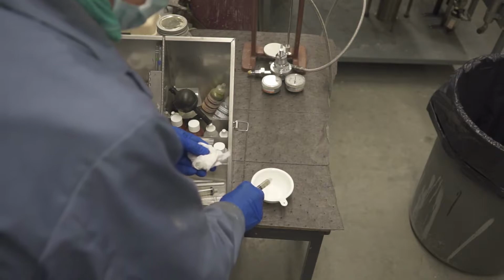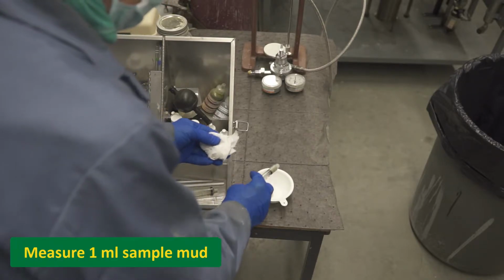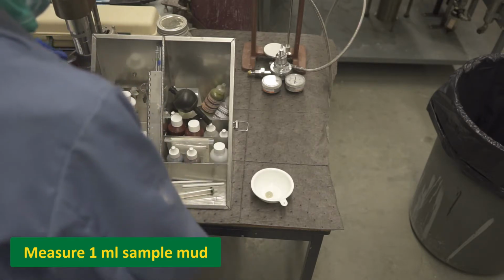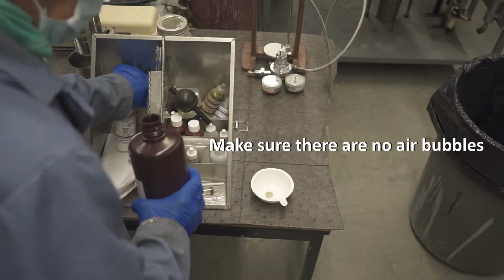To measure mud alkalinity, first use a syringe to measure 1 milliliter of a freshly stirred sample of mud into a titration dish. Make sure there are no air bubbles.